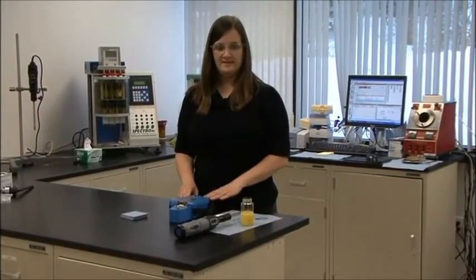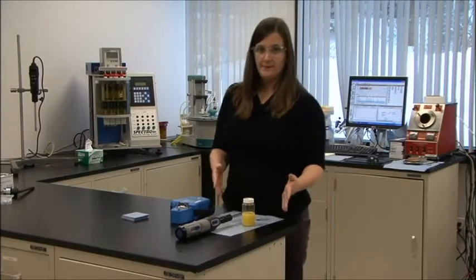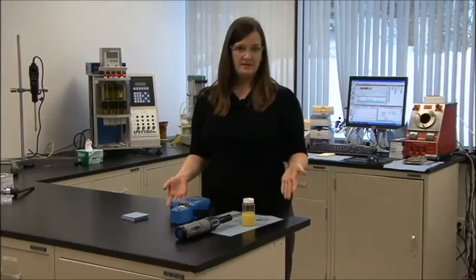And I'm analyzing my sample. So as you can see, including the homogenizing time, I'm going to get my answer in less than two minutes.